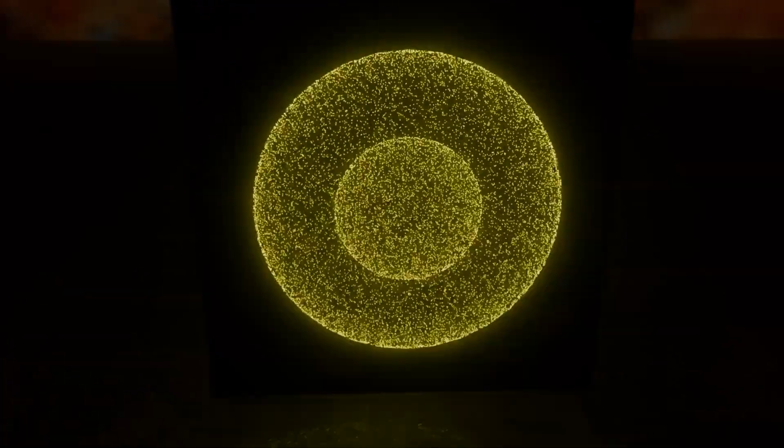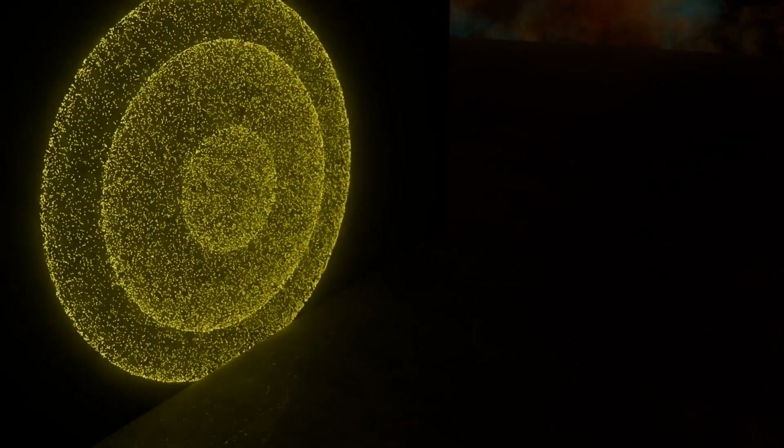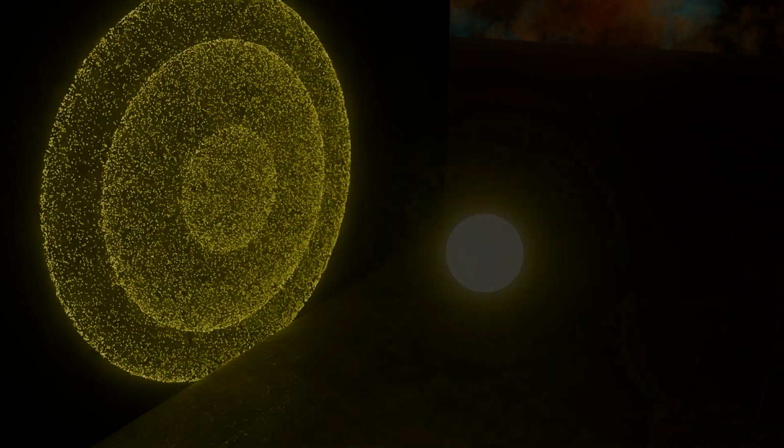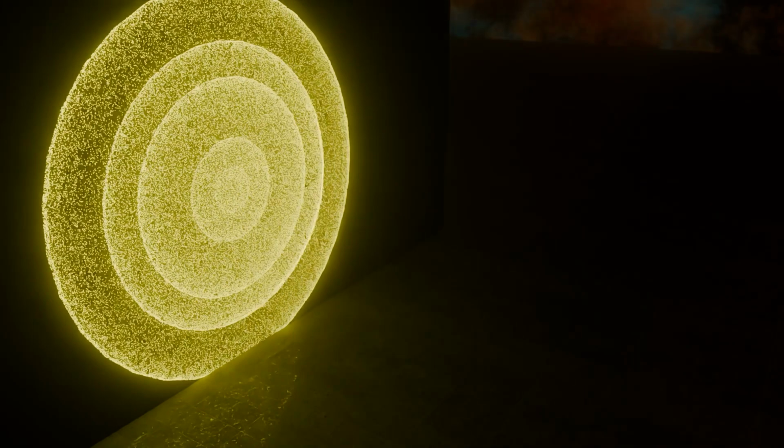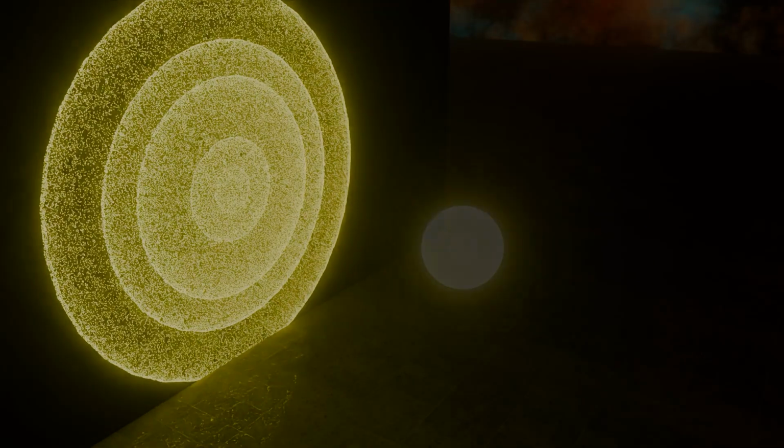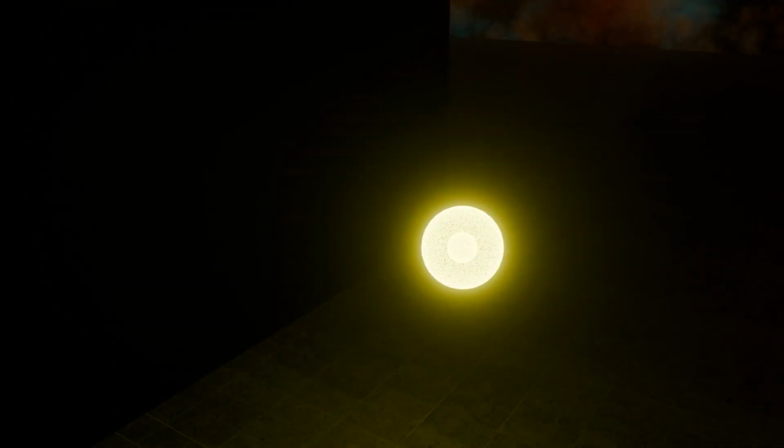Isn't that quite something? Now we can see it with multiple spheres. It works in the same way, and there. That's our output. Honestly, I gotta say the geometry nodes I did for this are quite lovely, so I'm just gonna do one more just for the sake of visualizing it. And there. And now after that, we're finally done. That is the full physical setup of the experiment.